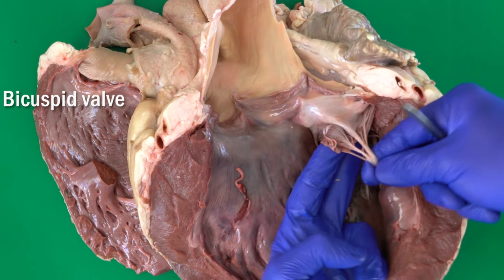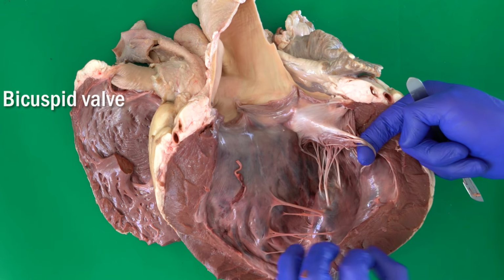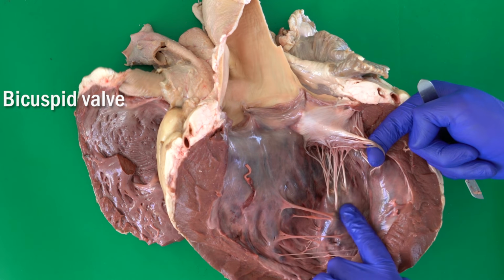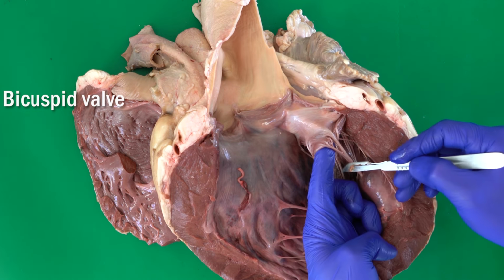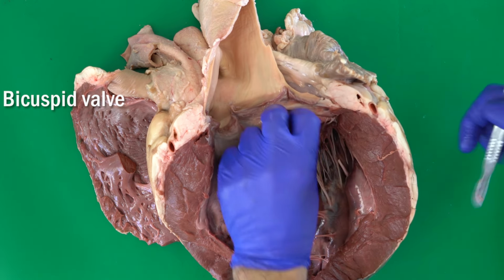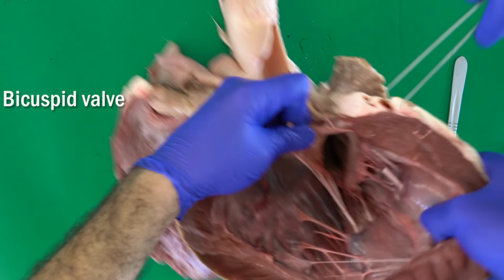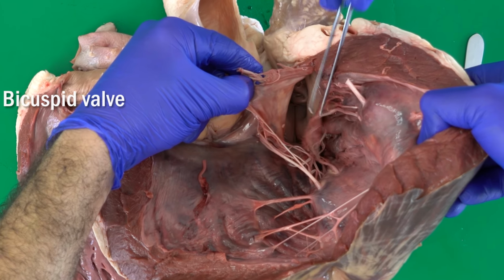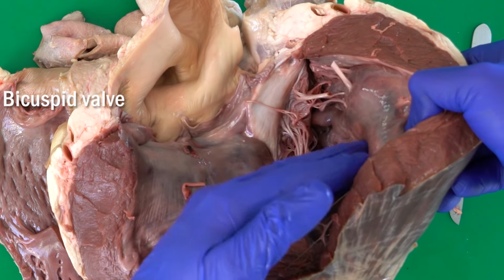Chordae tendineae, very strong tendons to hold the cusp to the wall of the ventricle, exactly to what's called the papillary muscle. This is the papillary muscle. It's a big muscle found in the wall. Here we have one, and here we have one. I will cut one of these chordae tendineae. It's really very hard even to cut. After that, I will separate it here to show you exactly the opening between the left atrium and left ventricle.